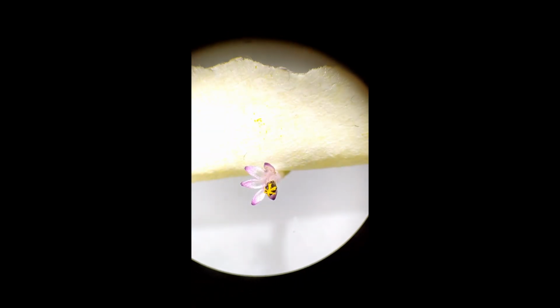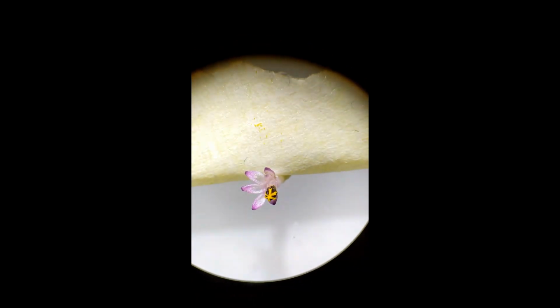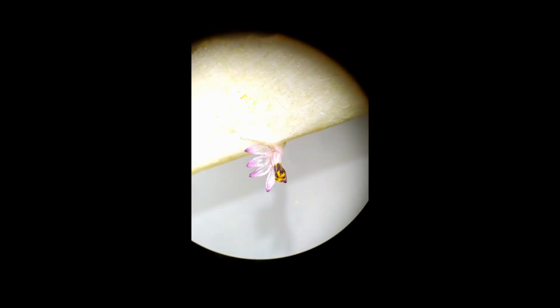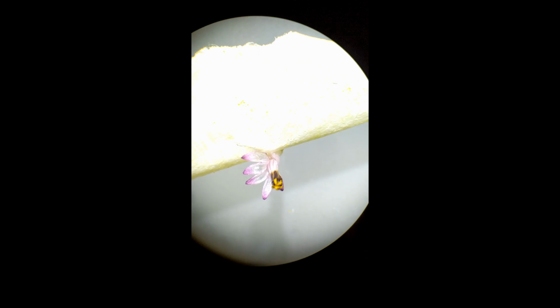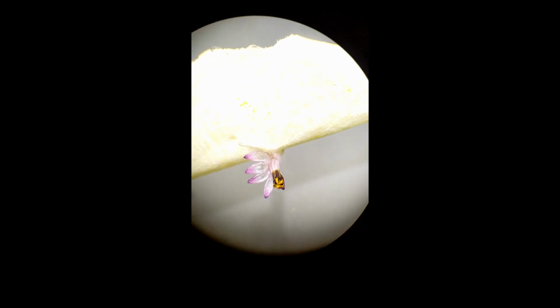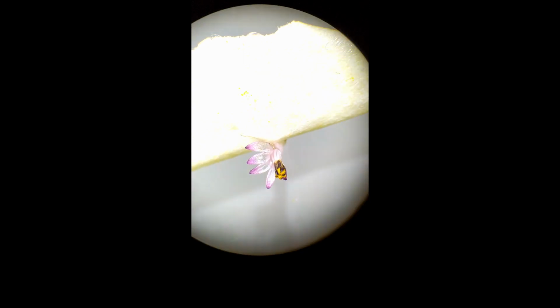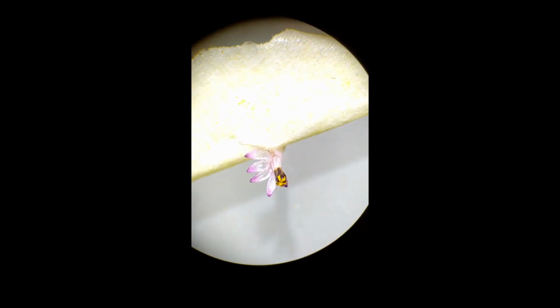Having it a little bit better here, you can see the pollen and the anthers, and you can see the filaments going up to the anthers, but all the anthers are conjoined to each other, so it's syngenesious. But the filaments of the stamens are free, and there's 5 of them, just as 5 petals over here as well. So that confirms that there are 5 petals on the ray flower as well as the disc flower.